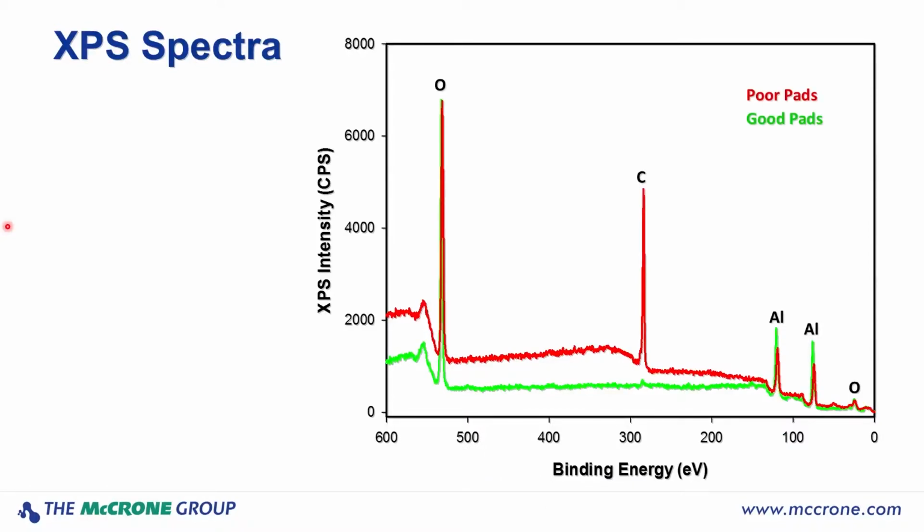Samples of the poor performing wire bond pads and the good performing wire bond pads were placed into our XPS instrument for analysis. The spectra shown in this plot are from one area on a poor pad and one area on a good pad. And we plotted binding energy of the photoelectrons versus photoelectron intensity. And the position of the peaks tells us which elements produce these photoelectron peaks. And so we see the expected peaks from aluminum and oxygen. These are aluminum wire bond pads exposed to the air, so they have a native oxide layer on them. But we also see a large difference in the amount of carbon on the poor pads versus the good pads, with a large amount of carbon showing up on the poor pads.